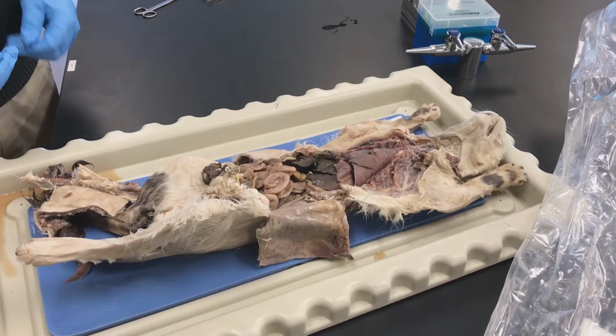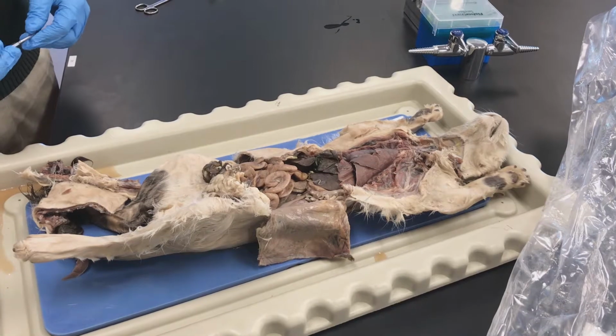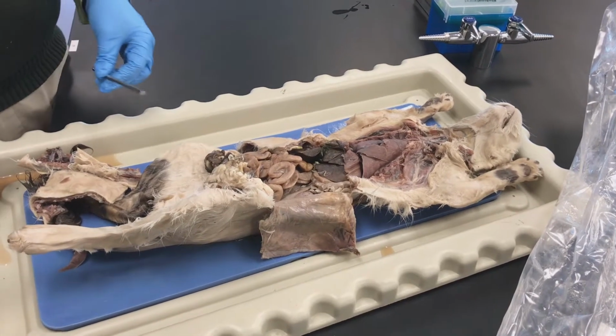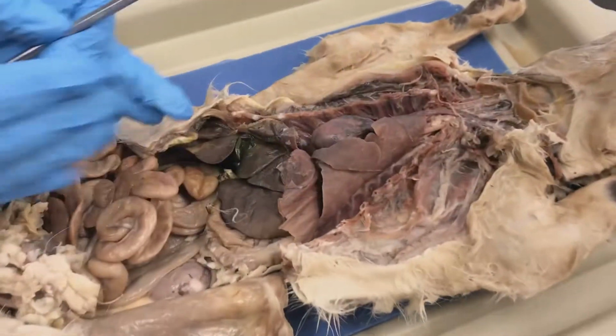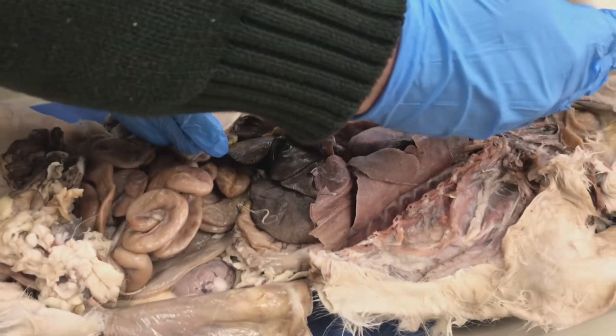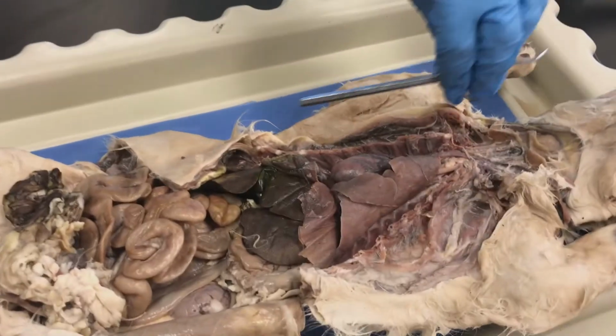So in this lab dissection, we want to go ahead and open up most of the cat's thorax. This one was already dissected. We're going to see a few other different examples. But this one, they went ahead and we opened up the thoracic cavity. We did a midline incision from the bottom of the pelvis all the way up to the top of the neck. They've removed the ribs, in this case.